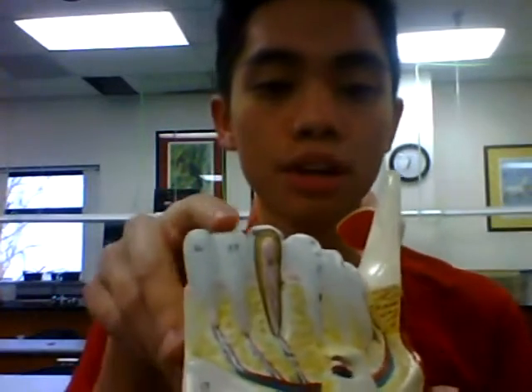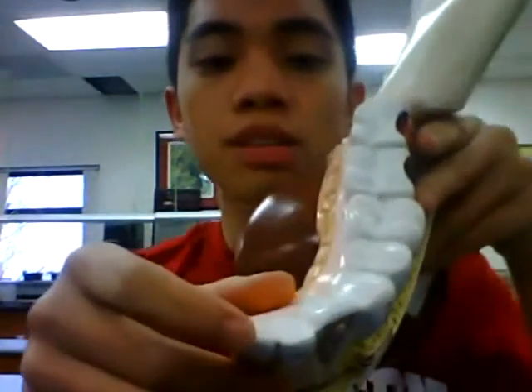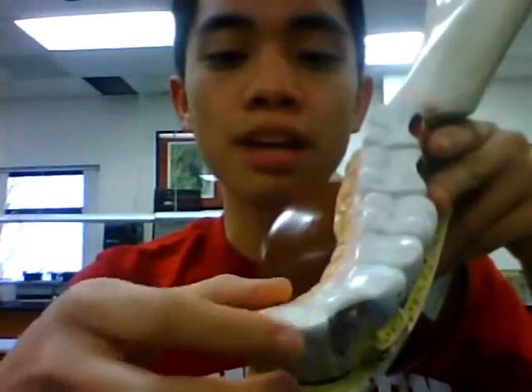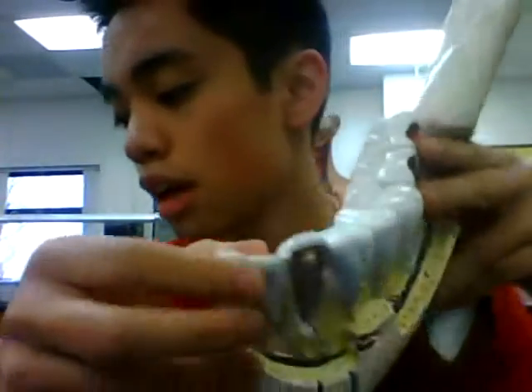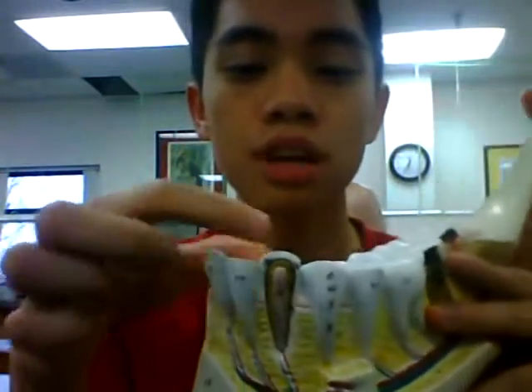Another thing that you need to know is the teeth. You only need to know four things. So you have these ones right here, the ones right here which have the little sharp edge. This is called the incisors. So these two ones are incisors.